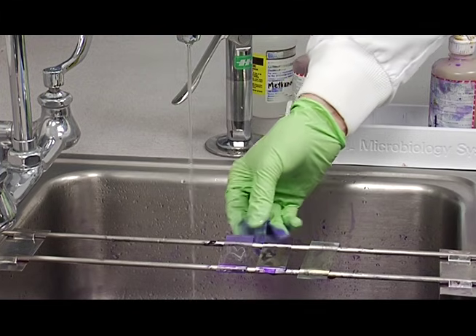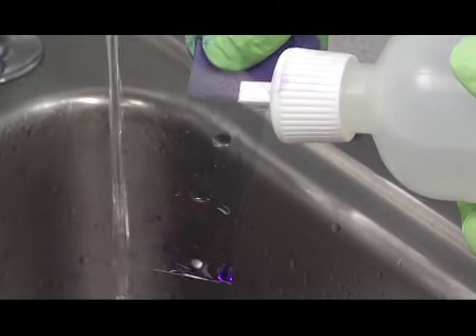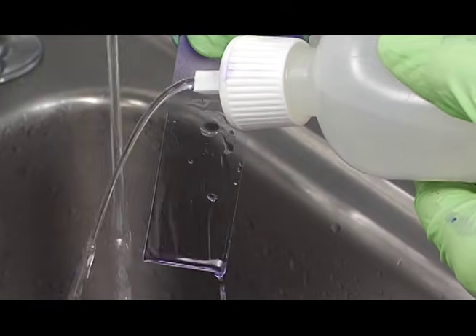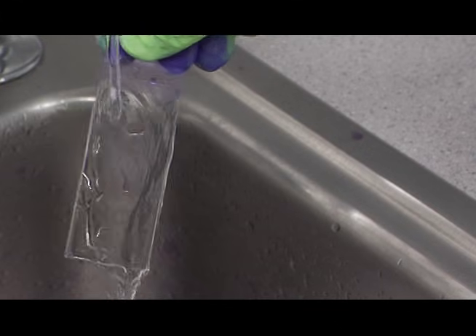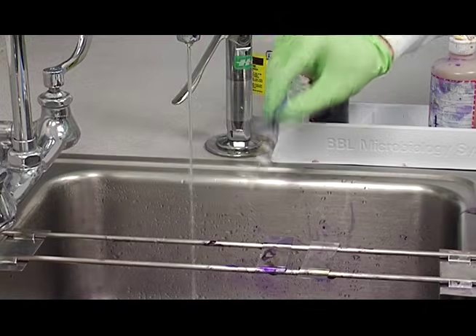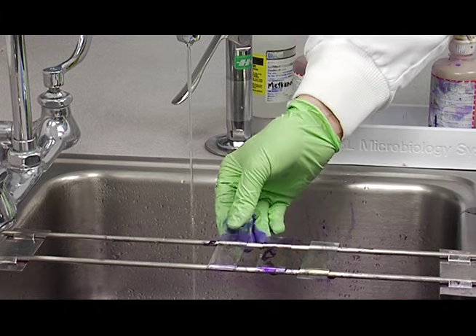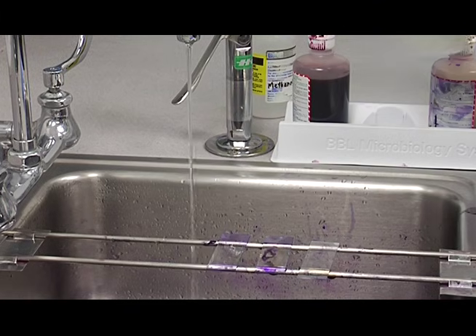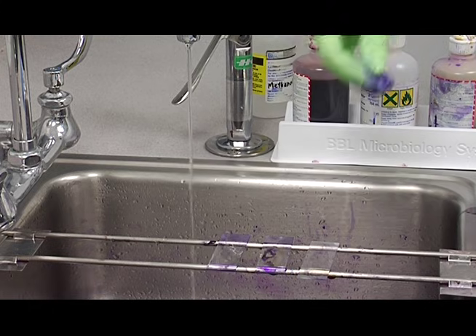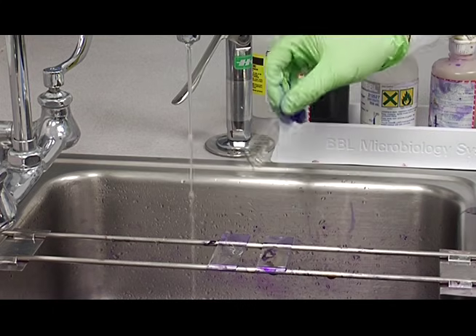And then our female genital tract smear. It's really important to shake off the excess water after each step.